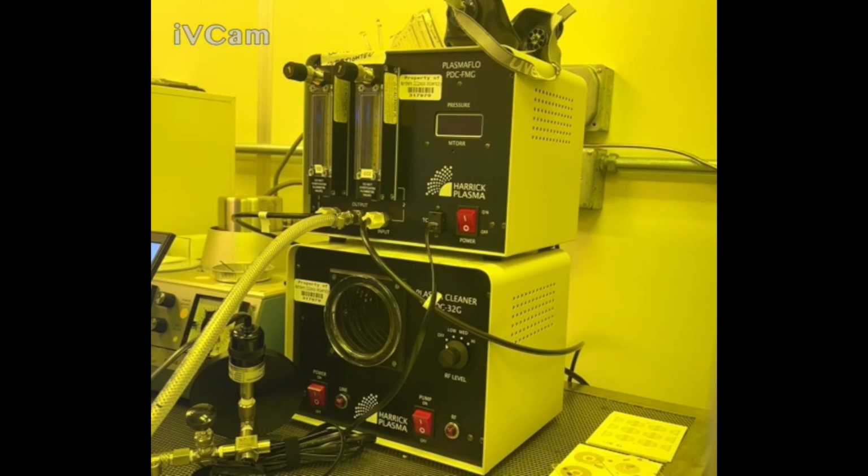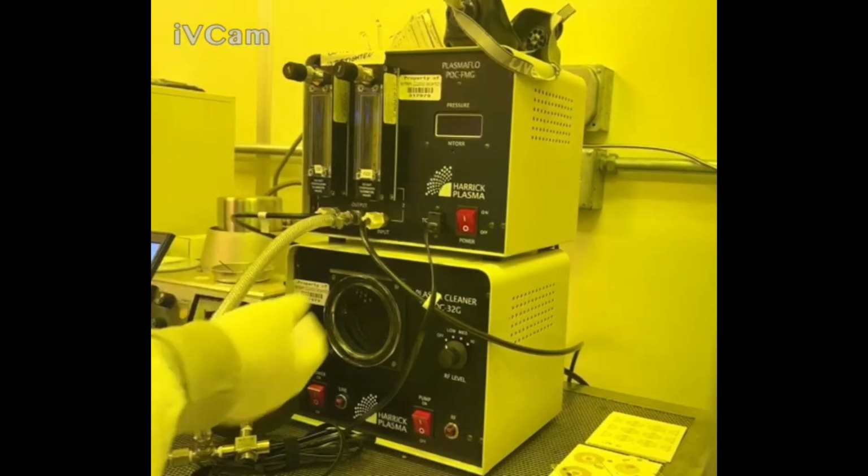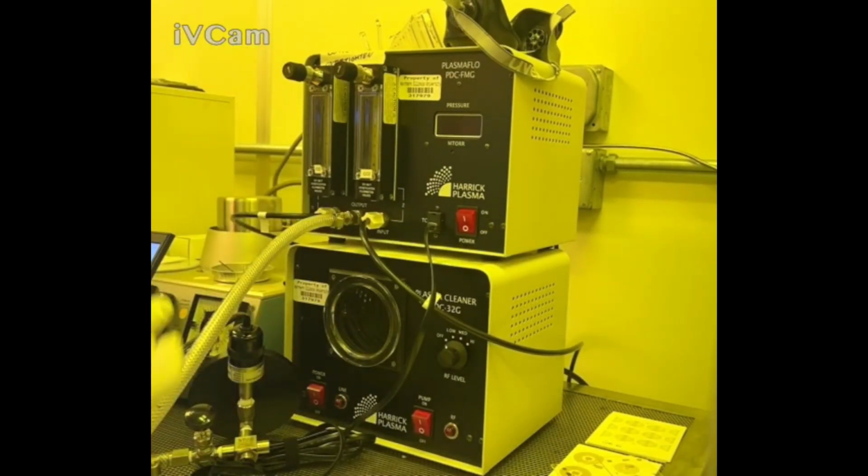This is especially important if, for whatever reason, the oxygen flow chamber is not working and you have to expose it to atmospheric oxygen. The atmospheric oxygen might not give you as good of a contact angle or as good of a treatment as using the pure oxygen here.